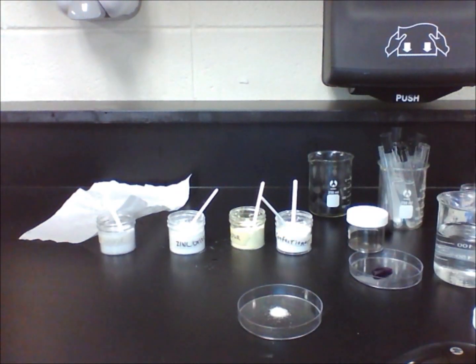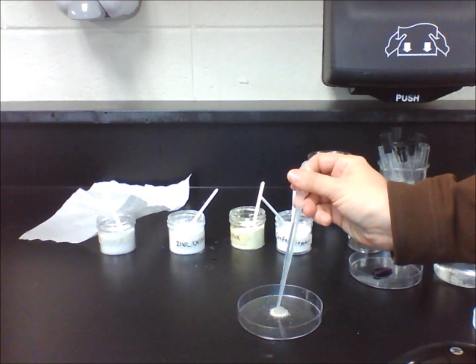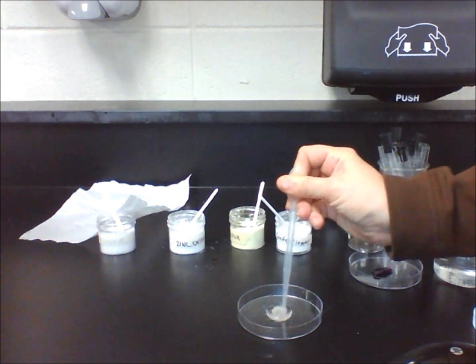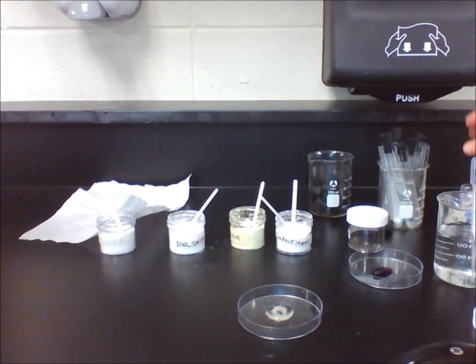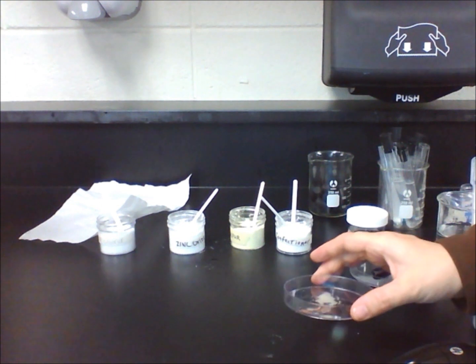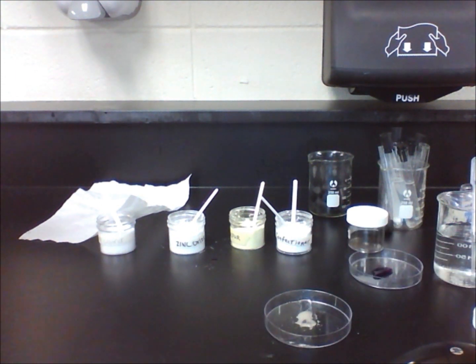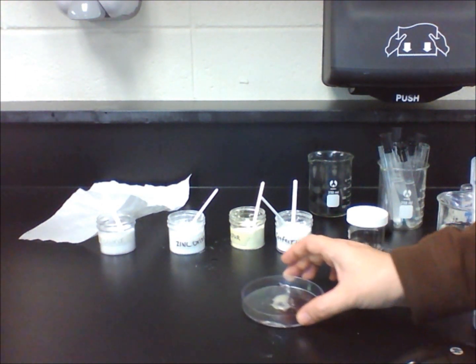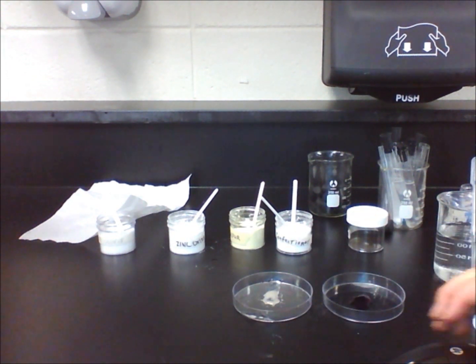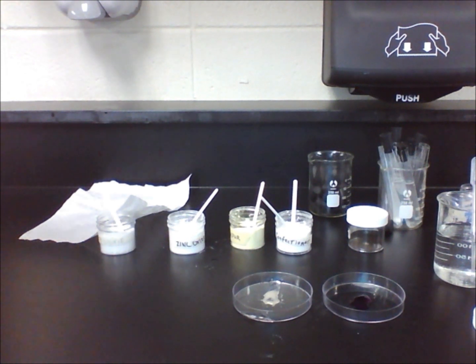When repeating the steps for sand, we can see that no change is occurring. The water is still clear, and the sand is still a solid. The solute did not dissolve in the solvent. Therefore, sand is insoluble in water. Students should be able to write in their own words what soluble, insoluble, solvent, solute, solution, and dissolve mean. These are terms that will be coming up in future labs as we learn about solubility of matter.